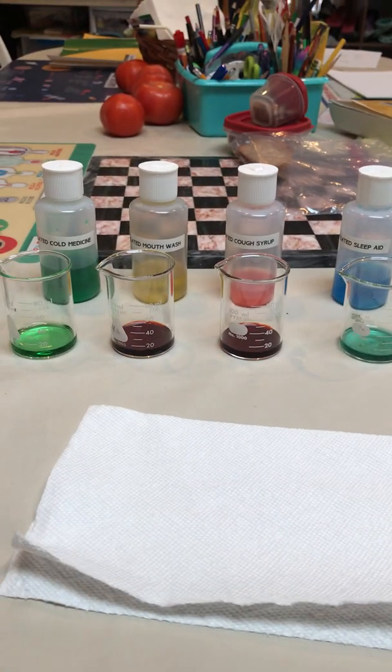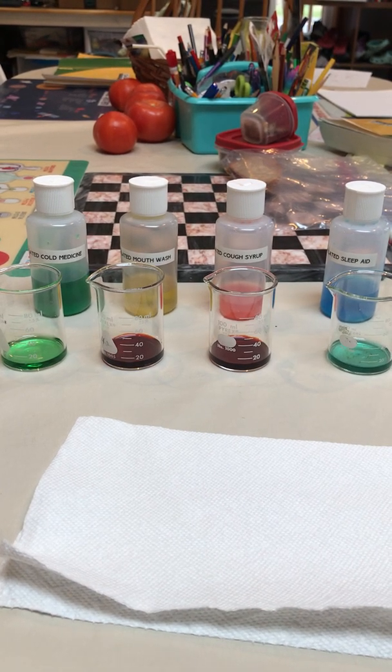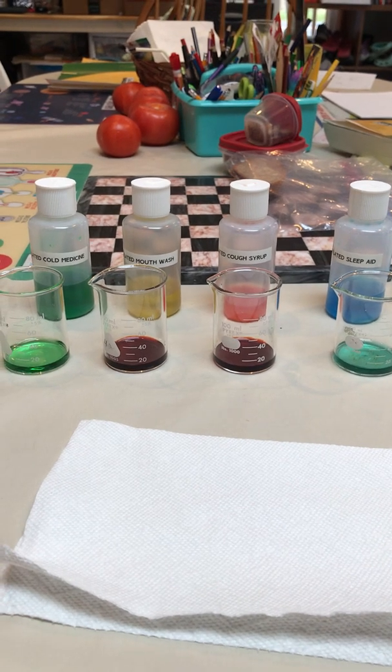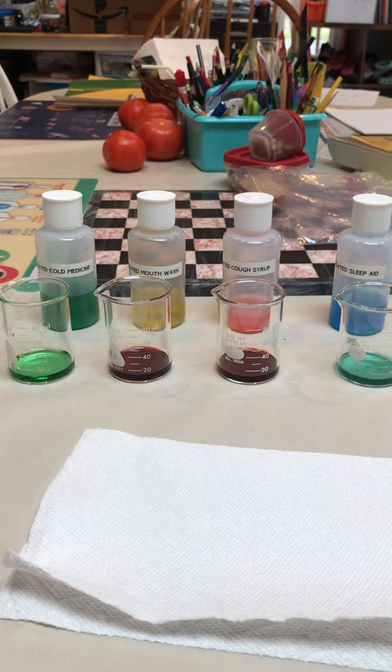So, what does that tell us? Well, remember, if you remember from our earlier experiments, a dark cherry red color is indicative of a positive cyanide test. So, my children, which of these medicines is contaminated with cyanide?